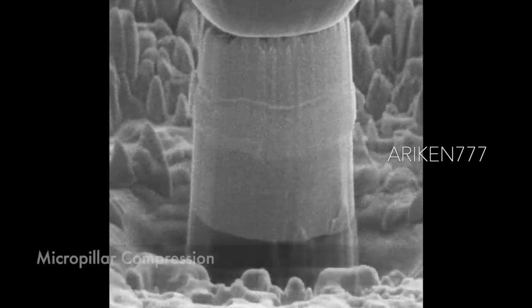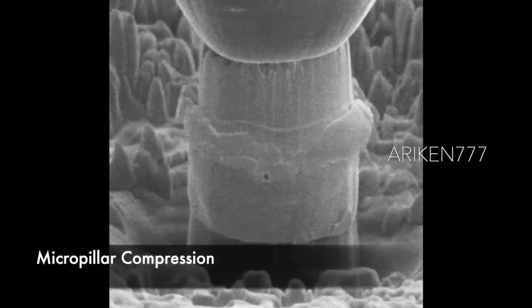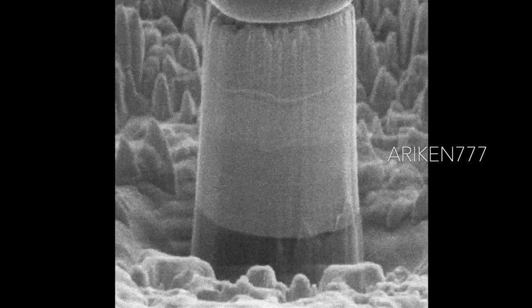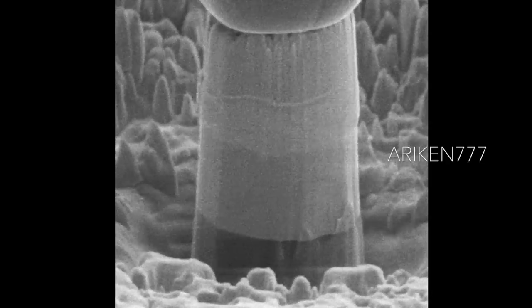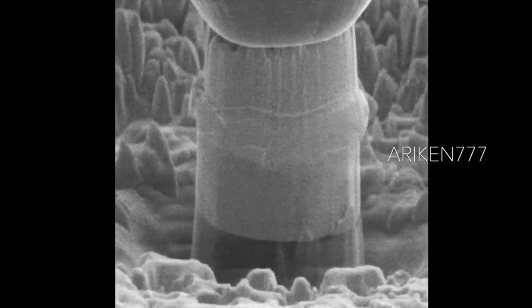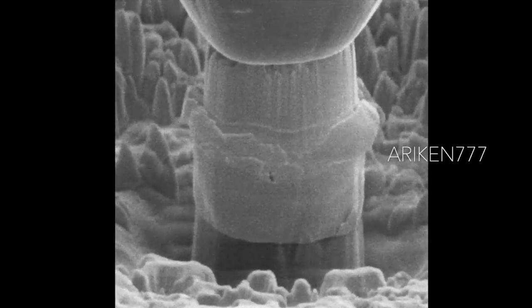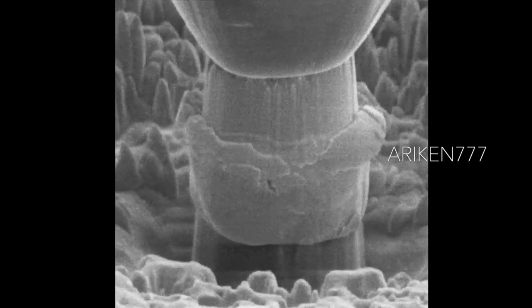This is a micro-pillar compression test on a micro-pillar built from a multi-layer stack of different coatings. These tests are done in order to precisely quantify various mechanical properties of materials on the micro-scale.